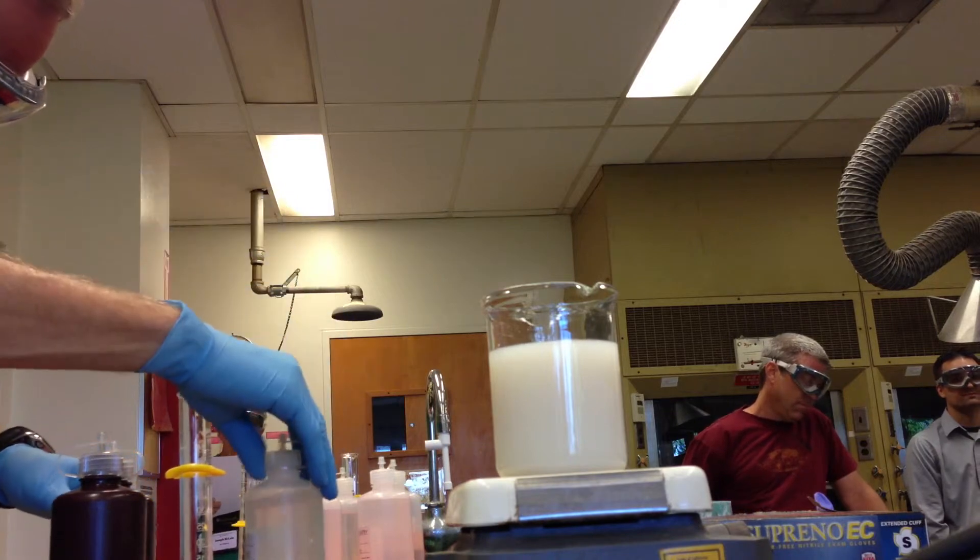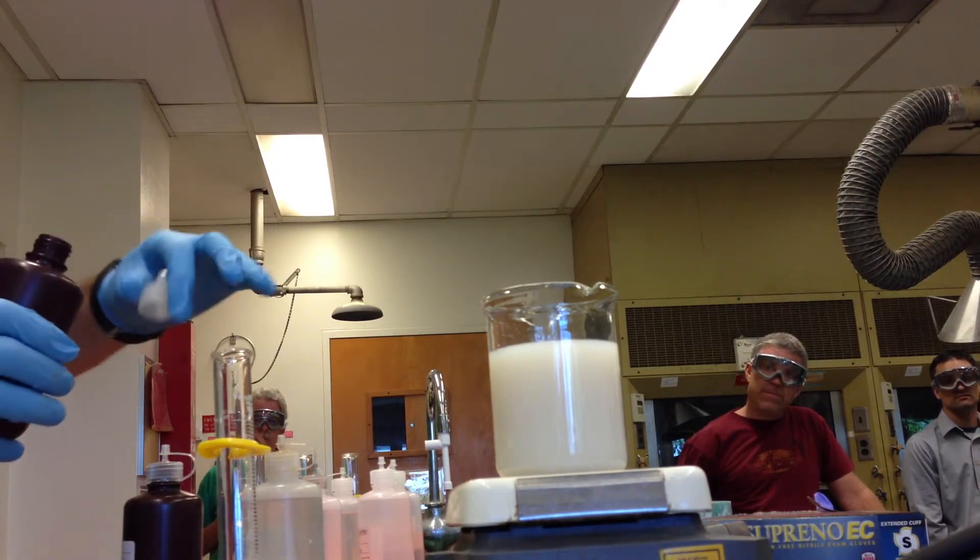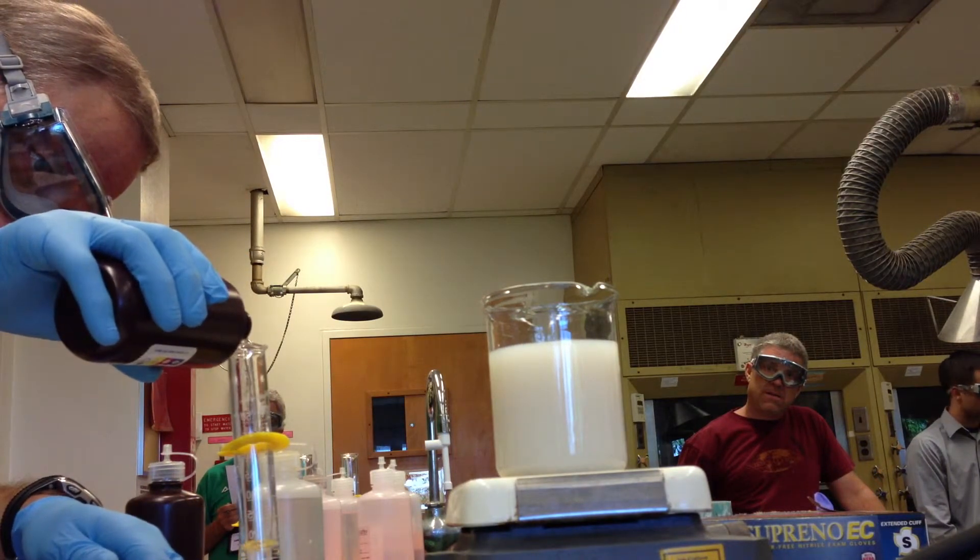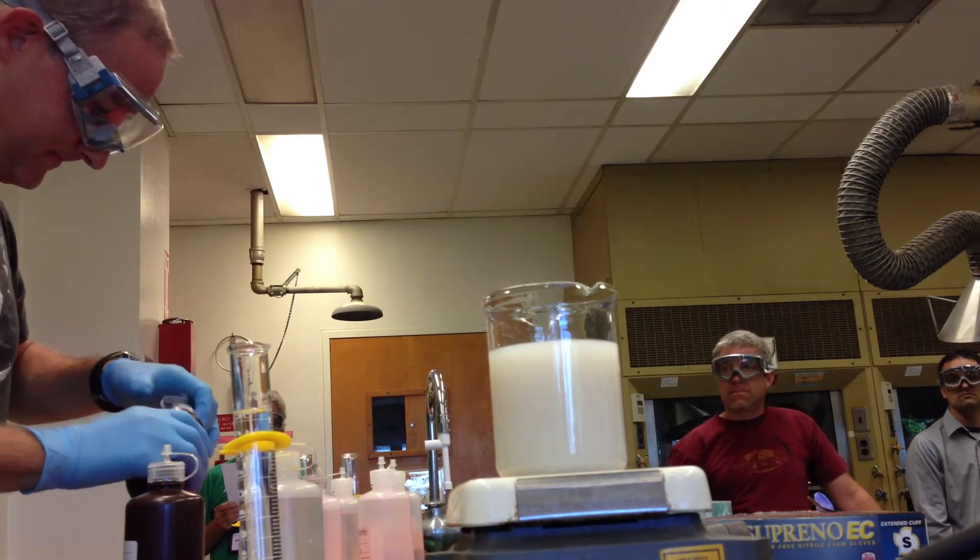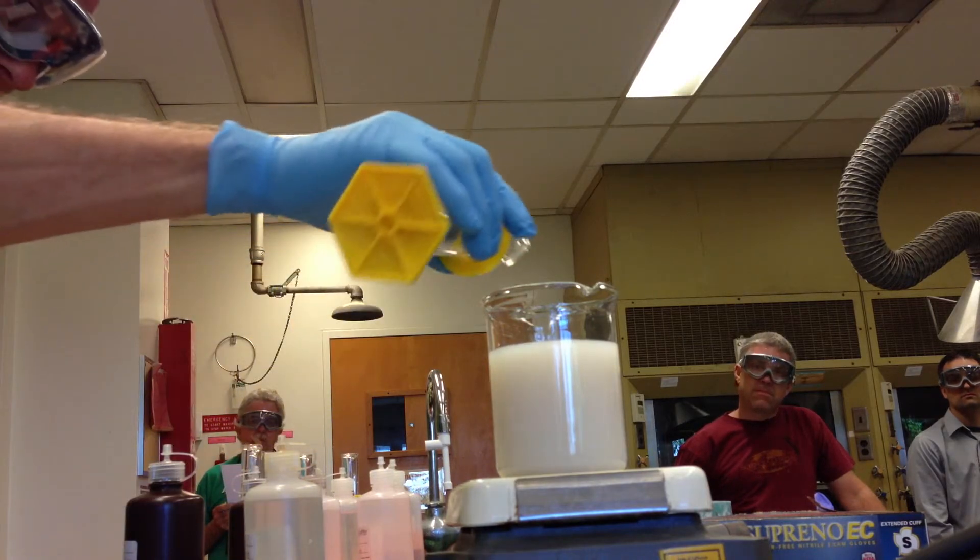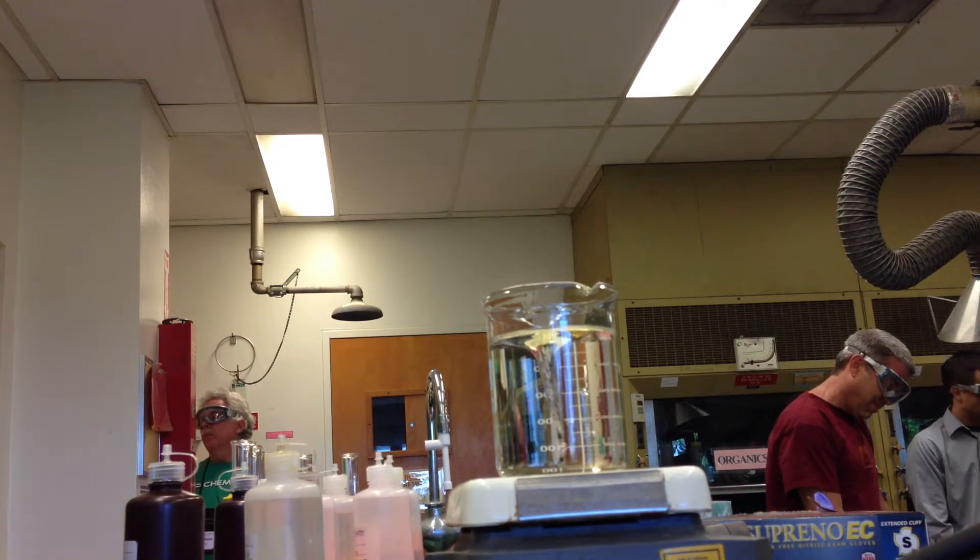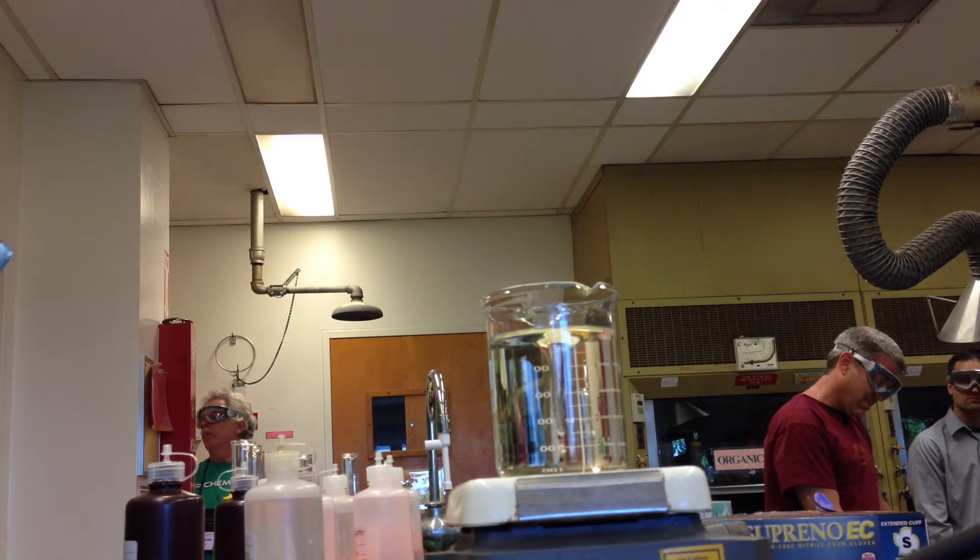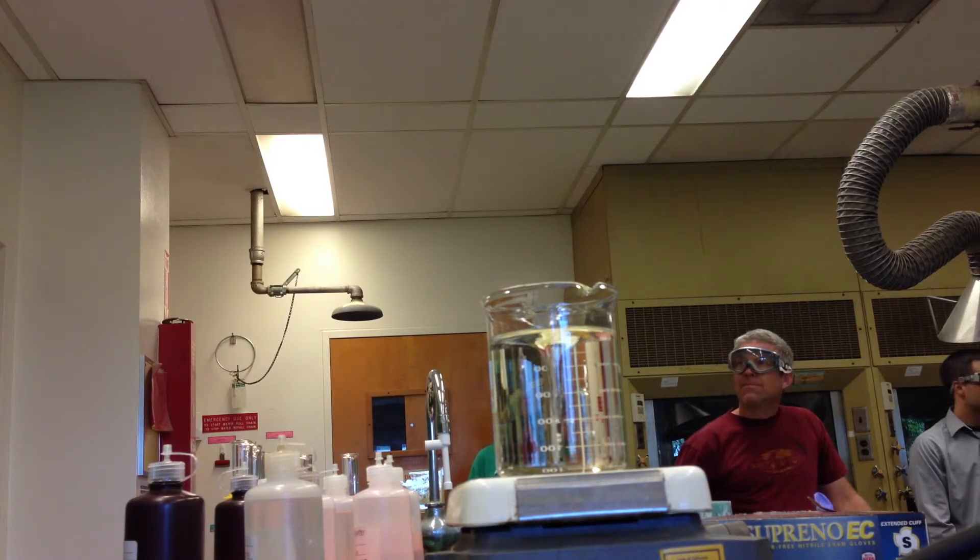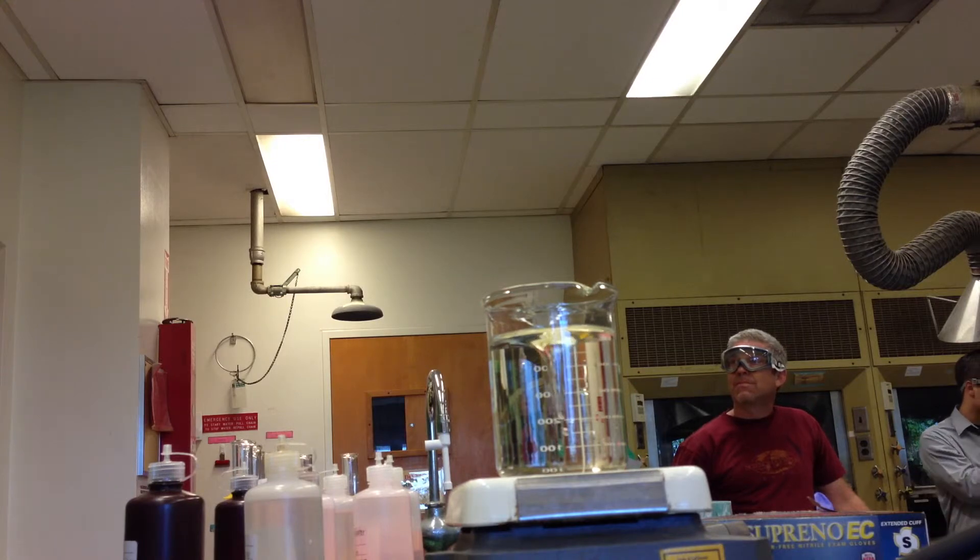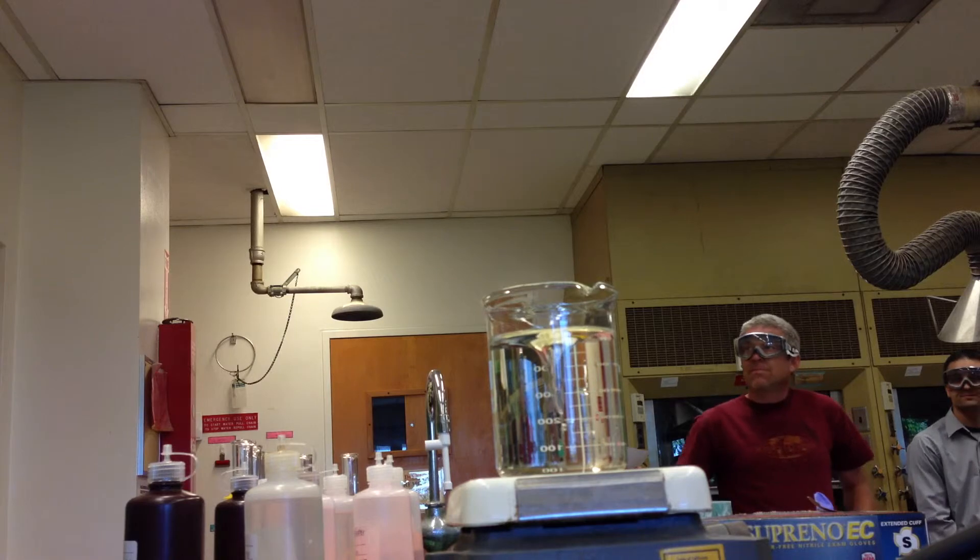Sodium thiosulfate. Where are you, sodium thiosulfate? Here you are. What color? No idea. Anybody? Transparent. It's not complex. I'm just putting what the recipe says. Yes, another complex ion. Really? Would I lie to you? Sulfato. Have I lied to you yet? Today? So what is this? Four, right? Two. Silver going plus one. Two plus one. No, minus three. I'm not sure that's the right formula. I have it in my book. We'll look it up. No, for the complex. That is. Yes.